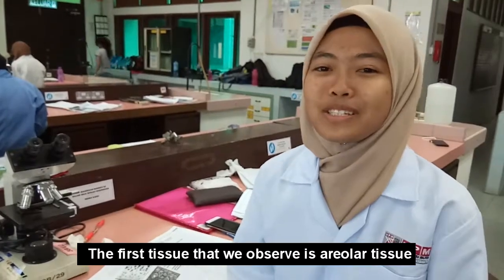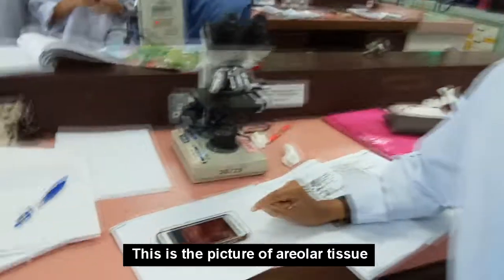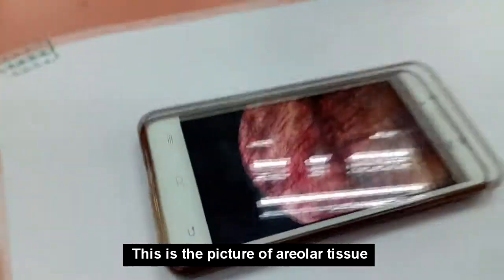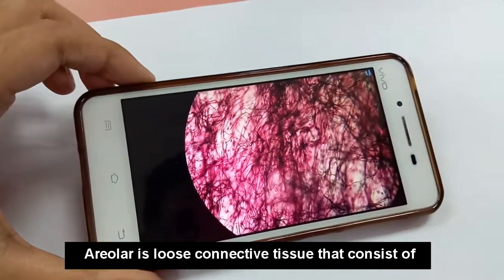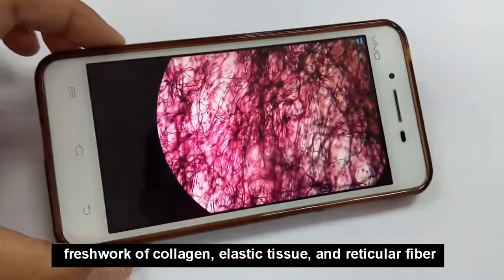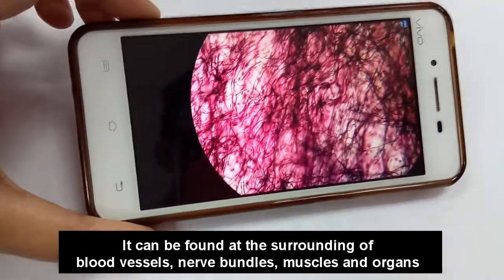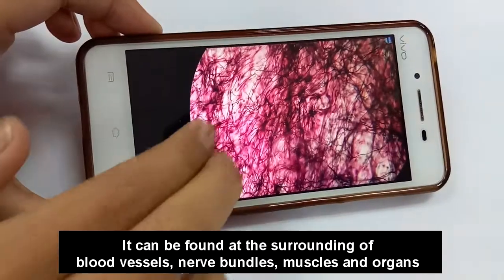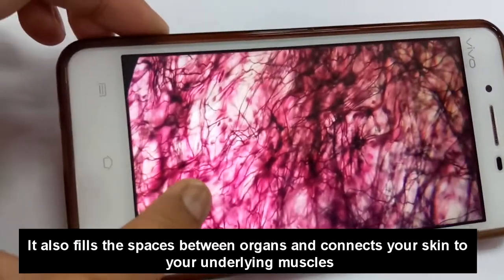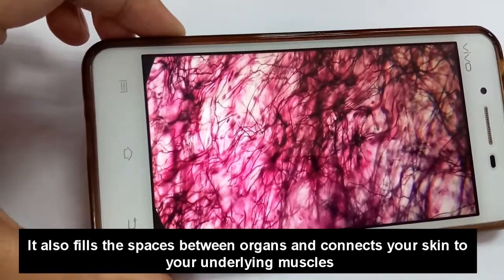So the first tissue that we have observed is the areolar tissue. So let's have a look. This is a picture of the areolar tissue. The areolar is a loose connective tissue that consists of a meshwork of collagen, elastic tissue, and reticular fibers. It can be found surrounding blood vessels, nerve bundles, muscles, and organs. It also fills the spaces between organs and connects your skin to your underlying muscle.